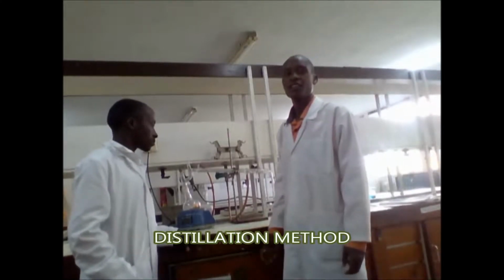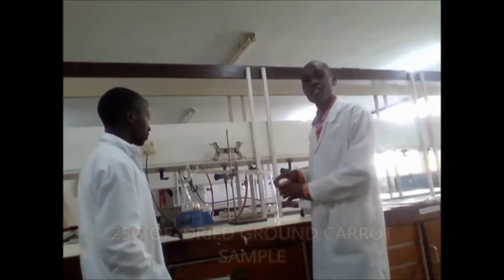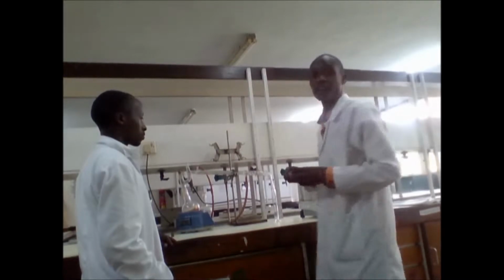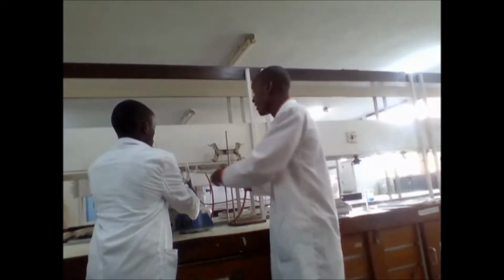Another method of determining moisture in food is the distillation method, and this method involves direct measurement of the volume of water which is removed from food by evaporation. This method involves the co-distillation of moisture together with a high boiling, immiscible organic solvent. The method is as follows. You measure 25 grams of the food sample. Then you transfer the food sample into a 500 ml flask.